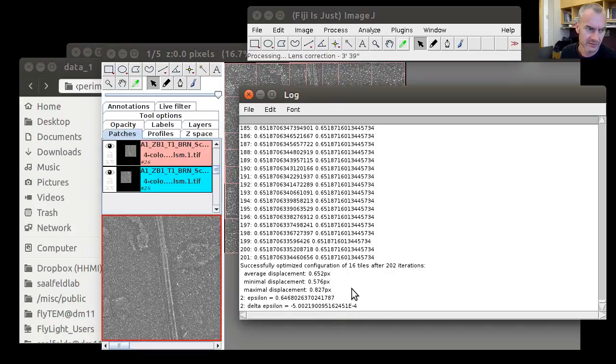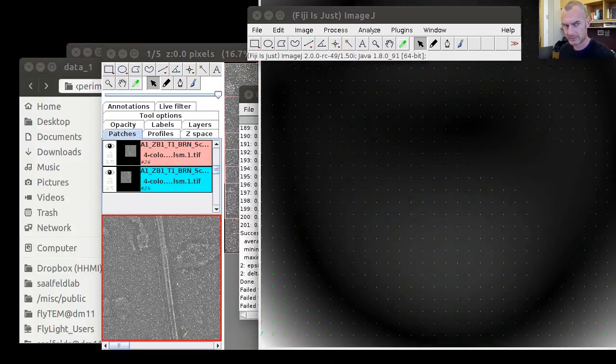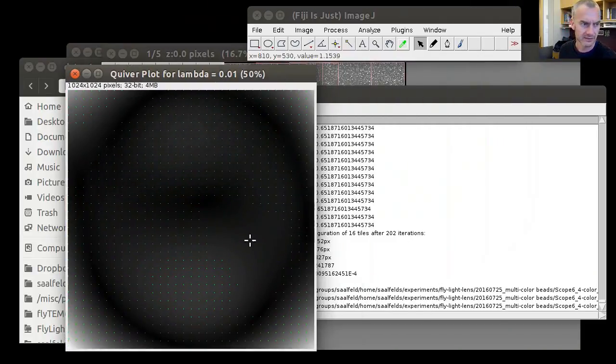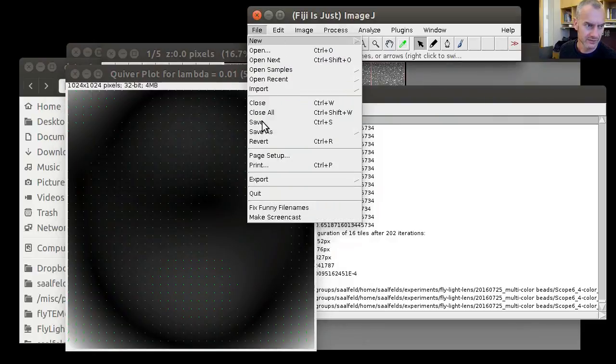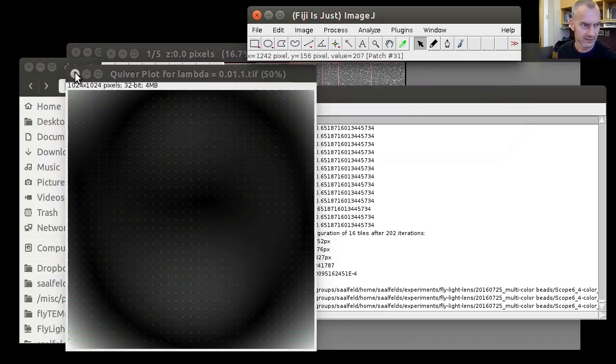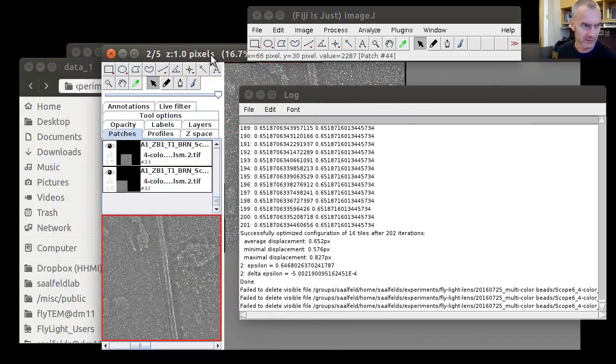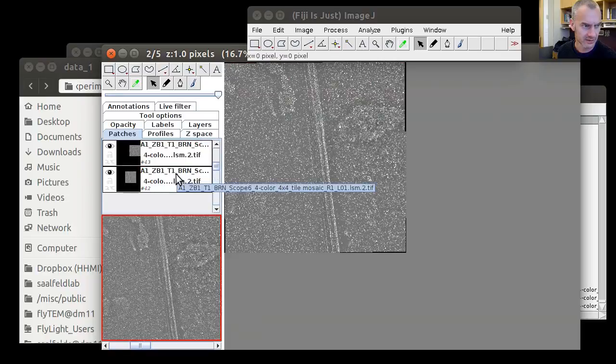There's not much of a difference for the second iteration. And so the algorithm stops and visualizes the lens correction model. And for visualization purposes, we can save this as channel 1 TIFF, and then we repeat the same operation in the next channel.